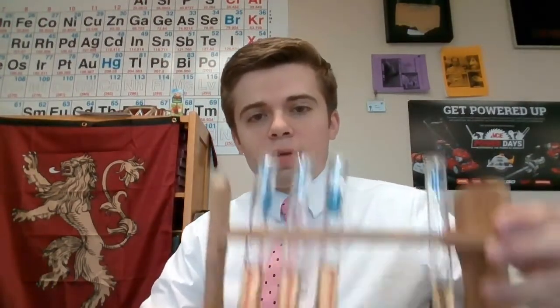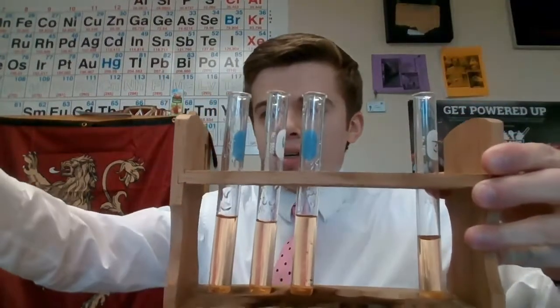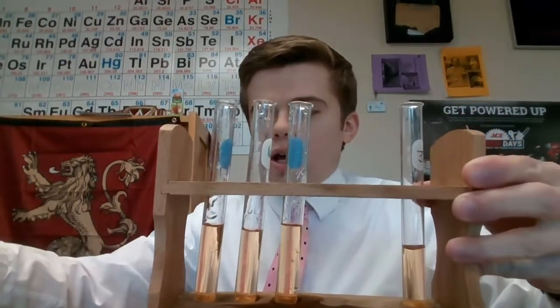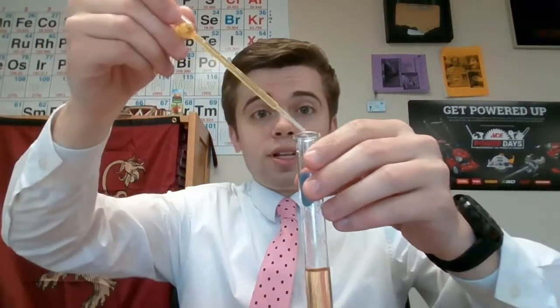Okay, so now I'm going to do our first little experiment here, and I'm going to mix in 20 drops of my iron chloride solution, which is in this pipette right here, into this test tube here. And I'm actually going to hold it up so that you can kind of see what's happening. We're going to want to record what is happening in here. We're also going to want to say what direction did our equilibrium shift.